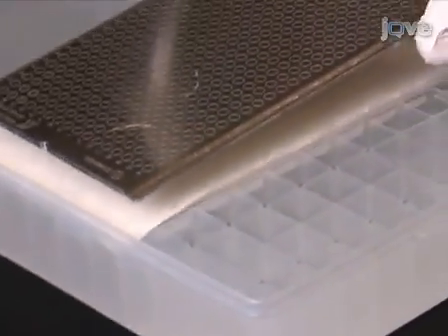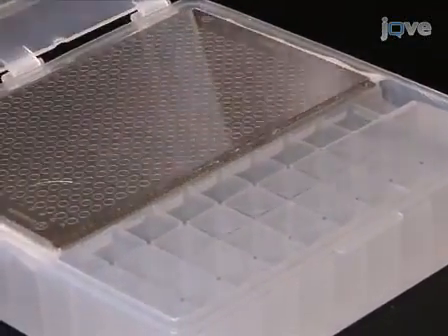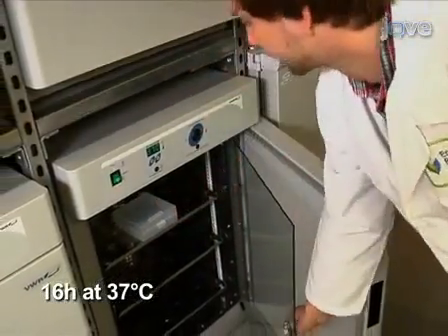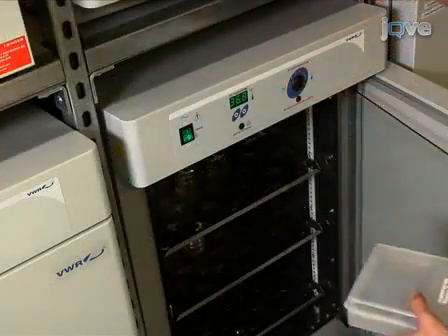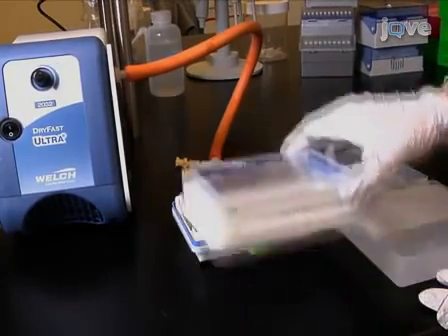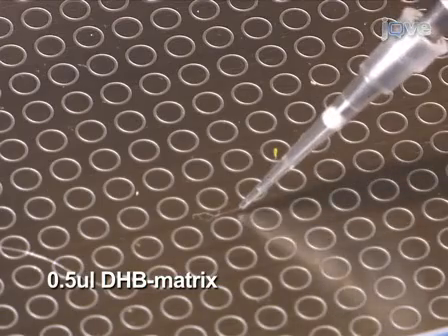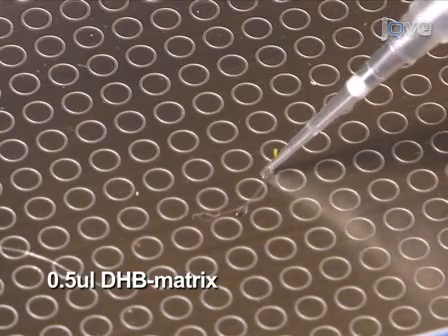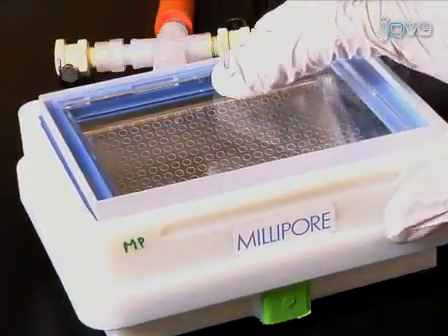Place the MALDI target plate in a closed container with saturating humidity to avoid drying out of the enzyme drops. Incubate the plate for 16 hours at 37 degrees Celsius. At the end of the incubation period, dry the enzyme spot under vacuum and add 0.5 microliters of the liquid DHB matrix on top of each dried enzyme spot. Then dry the MALDI target plate under vacuum.